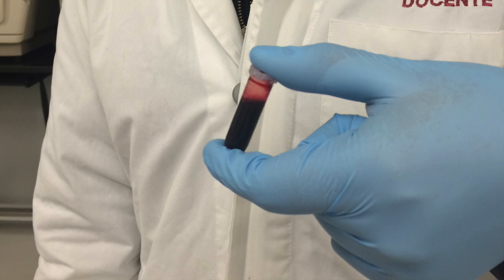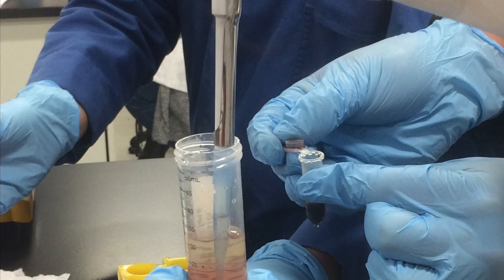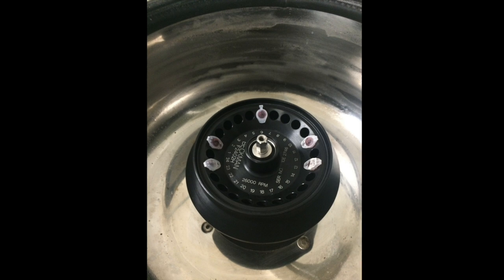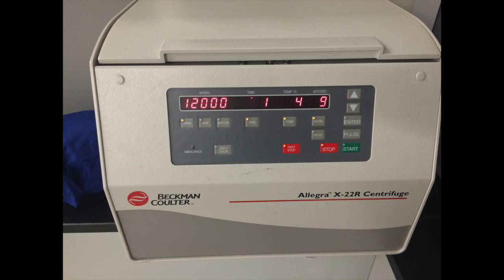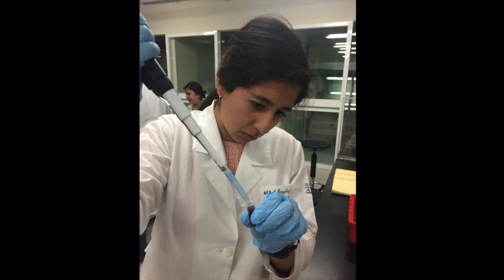The most important difference between the methods of extracting DNA and RNA is the reagents used to eliminate the proteins. In the isolation of RNA, one must proceed carefully to avoid contaminating ribonuclease degradation, either from the experimental material itself or by the operator's handling. In the preparation of DNA, there is degradation by deoxyribonucleases, which are activated by divalent metal ions. It can be avoided in the presence of chelating agents and SDS. Another difference is that DNA precipitation uses ethanol, and RNA precipitation uses isopropanol.